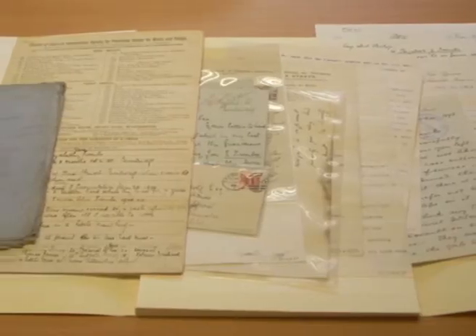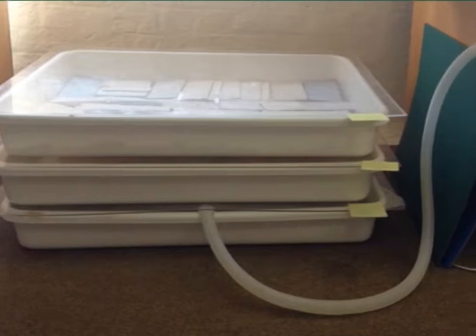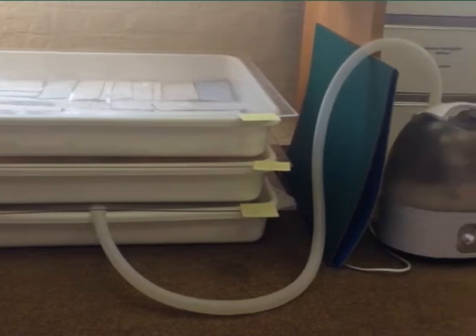Instrumentation of ESDA — preparation of apparatus. First is humidification: the electrostatic detection apparatus depends on the relative humidity of the environment. If the ambient relative humidity is less than 60 percent, document humidification is required. If greater than 60 percent, humidification is not required. Extreme humidification can destroy the document. Maintaining appropriate humidity is an important step to preserve the document and avoid it from getting wet.